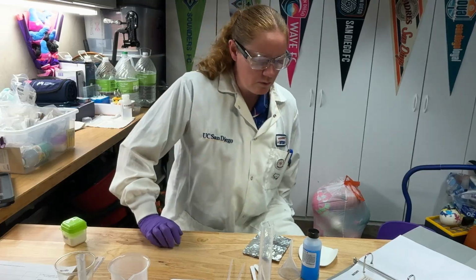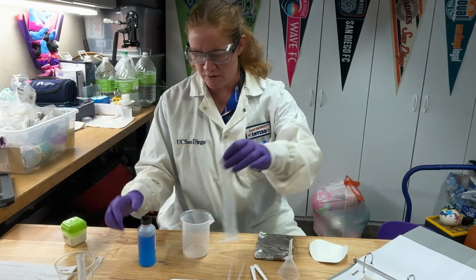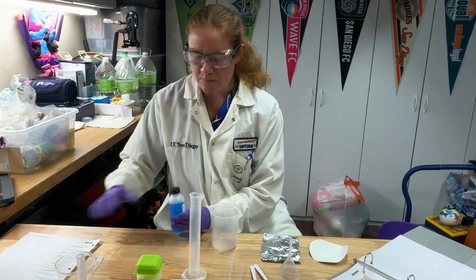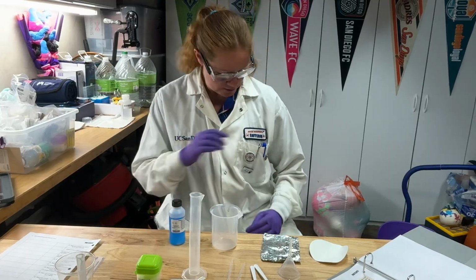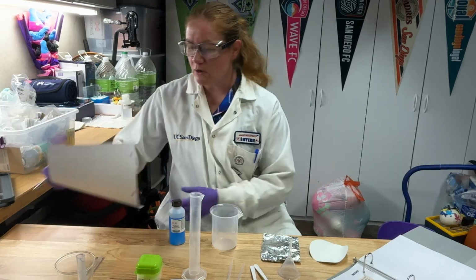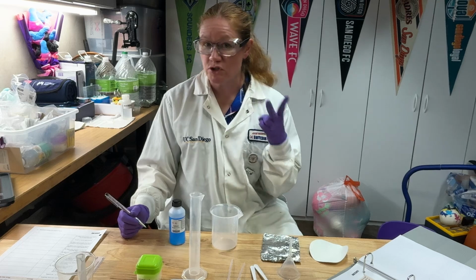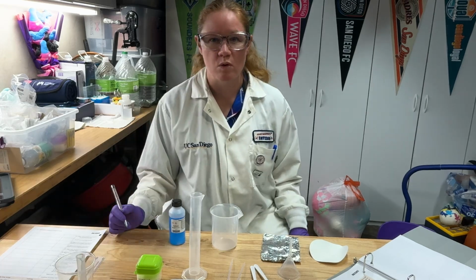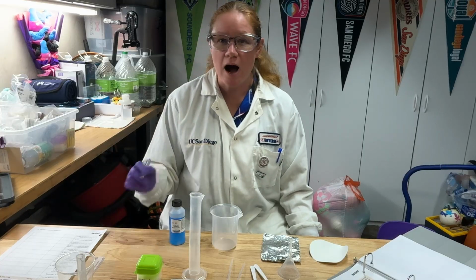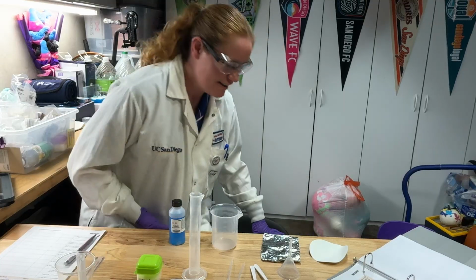Okay, so what you're going to want to do is make sure that you know how much of your copper 2 sulfate you are putting into your beaker. This bottle is going to have more than 50 mils in it. So on your data table, for that volume of 1 molar copper 2 sulfate, you're going to need to write 2 volumes down. It says show your work, so this will just be a simple addition. In my show your work spot, I'm going to write both my volumes down so that I can add them when I'm done.